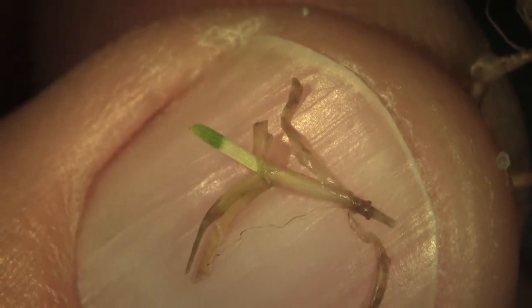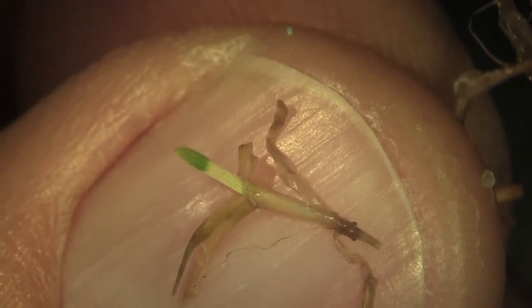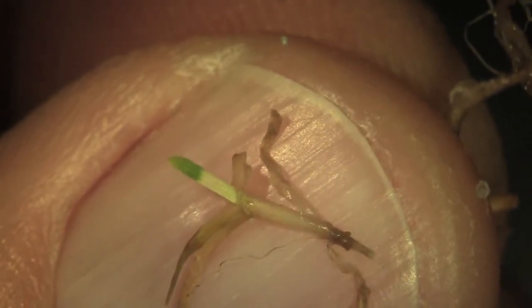Looking at another one of these samples where we see the bleaching effect, the base of the plant is dark, which is very similar to what we'd see with summer patch. But you've got a nice bleached-out section of the leaf, so it looks like something happened — probably something environmental — that triggered maybe a toxin or some sort of effect that stopped those plants from producing their chloroplasts.